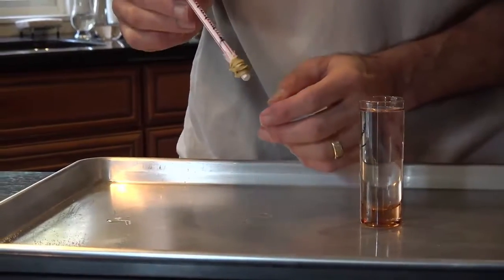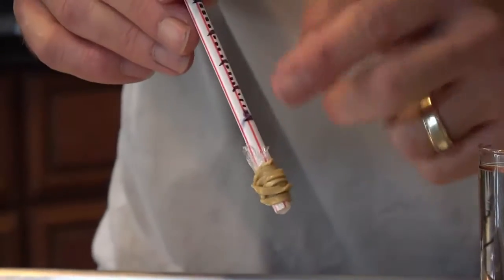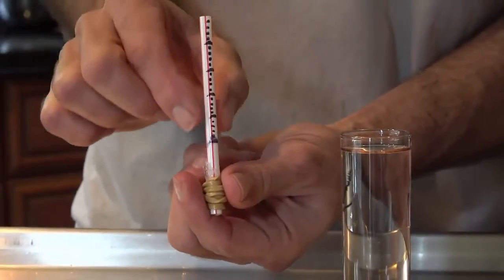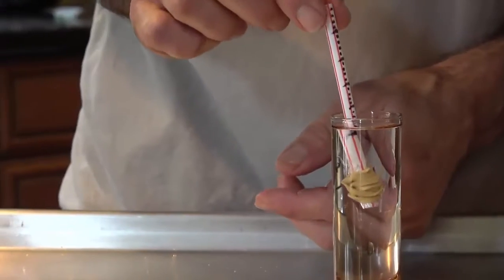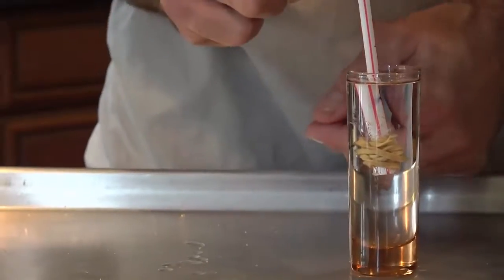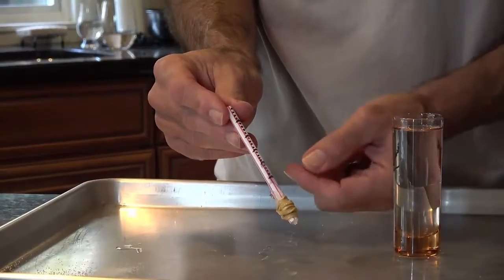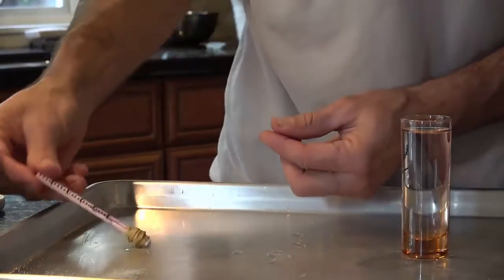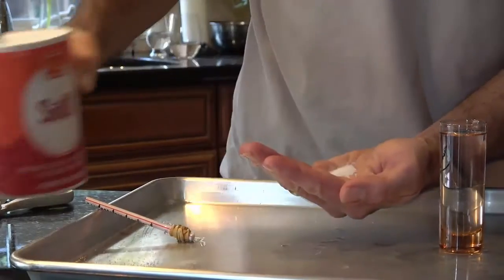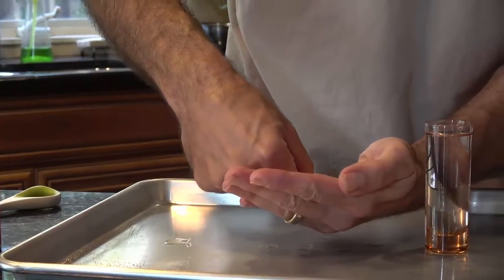And you have to be a little quick with this and try not to touch your marks, because the alcohol really wants to make those marks go away. So try not to touch them. Try to hold it on the side where there are no marks, and we'll set it in here and see what happens. And I can use a little bit more weight. I want it to be very close to the bottom but not touching the bottom. So I'm taking it out pretty quickly. See, it's already starting to mess with my marks on here. I might have to redo those a little bit. But I need a little bit more salt. Get a little bit more inside the straw.